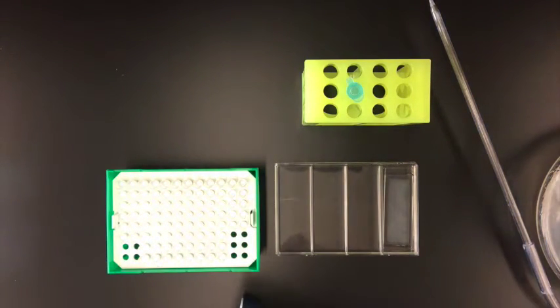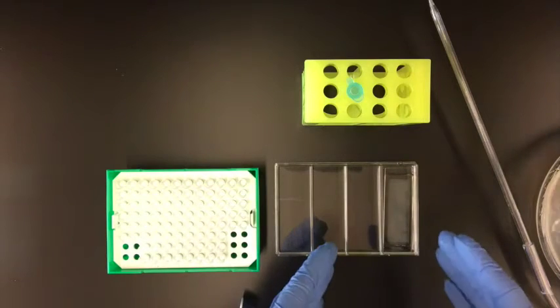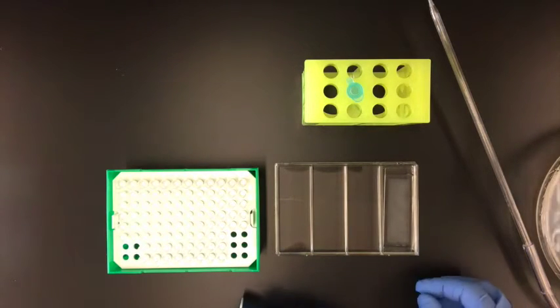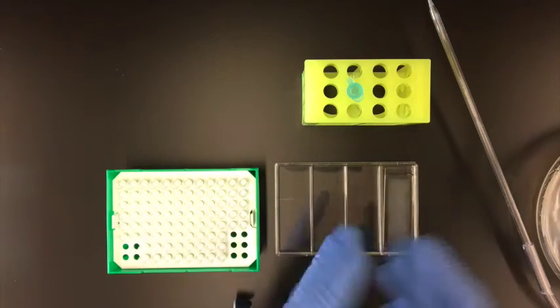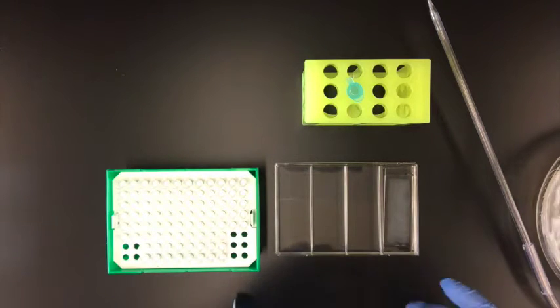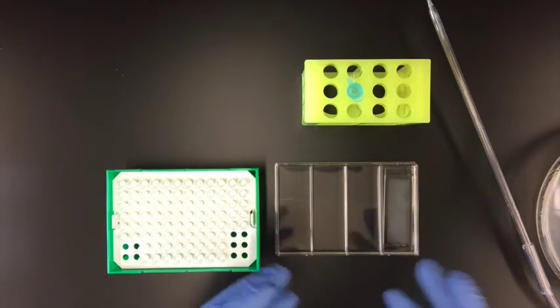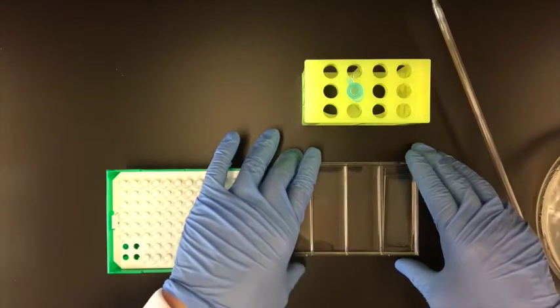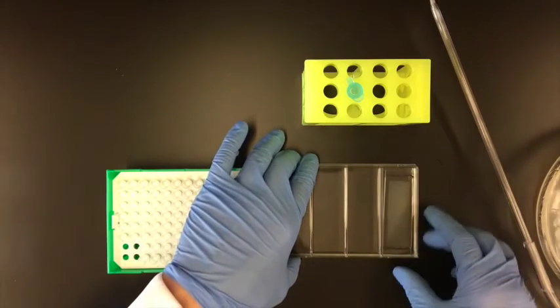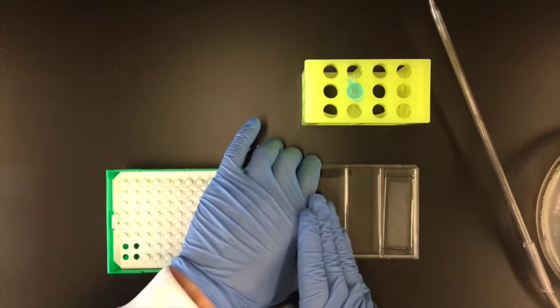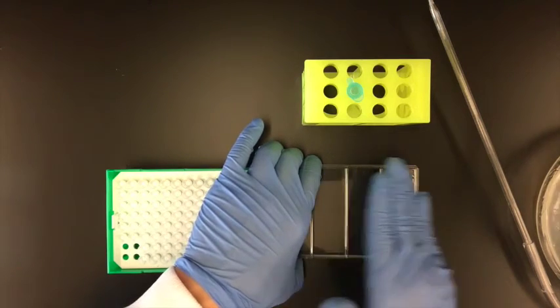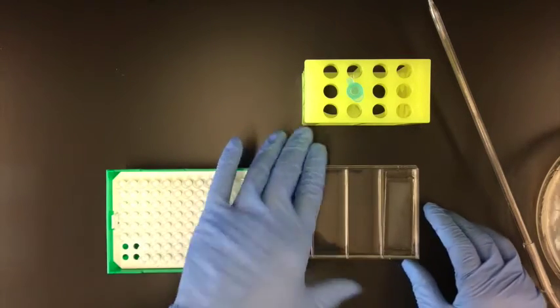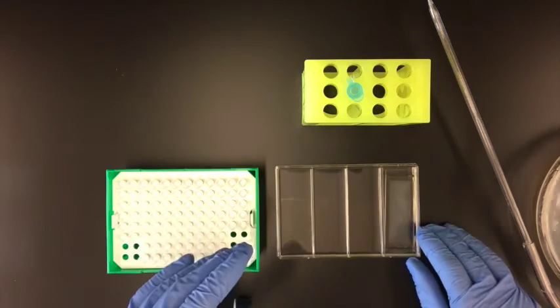Now one thing that you can do is you can intermittently rock to let the beads settle in. So they need to be still to actually fall into the wells. But then we want to allow the beads to run to one side. The hardest part of the array to load, in my experience, is the edges.